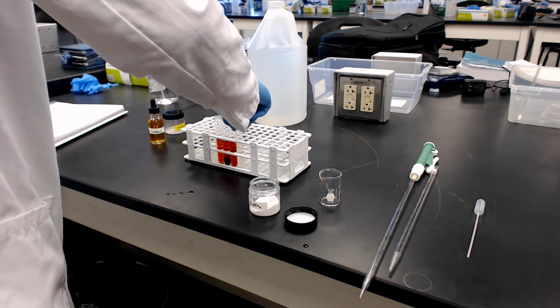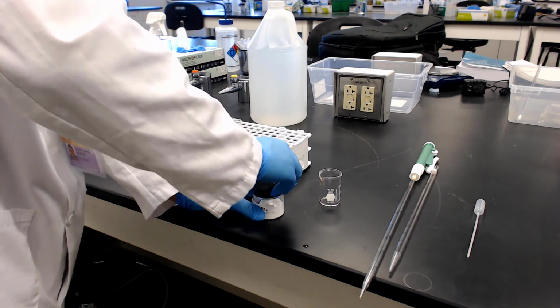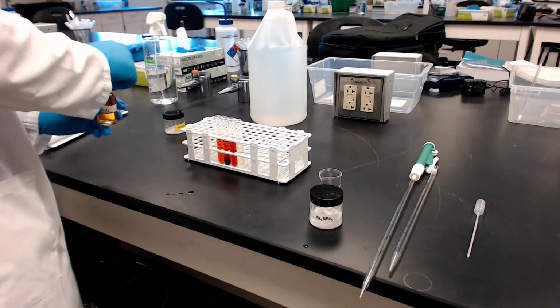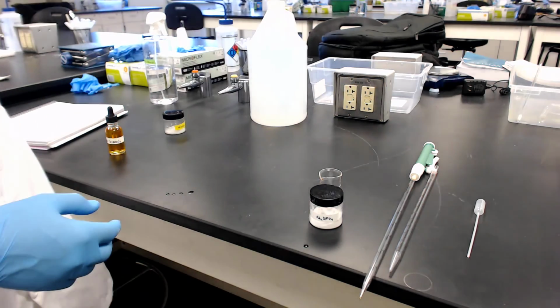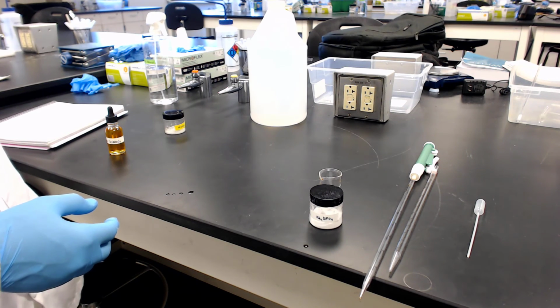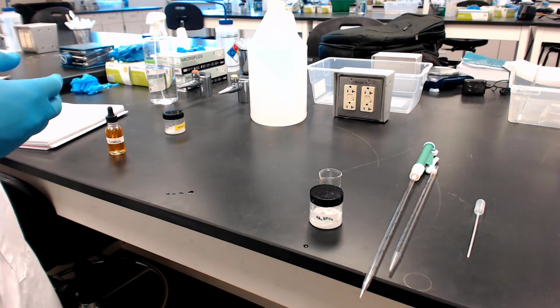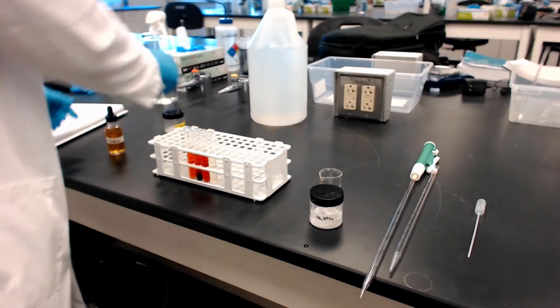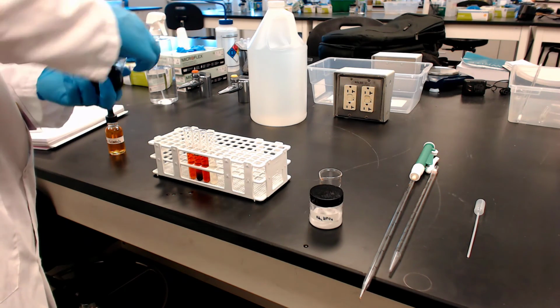So there you go. That completes step A, and we'll see if he gives us one good shot with everything done here. We'll see. There we go. And I think I'll also upload a picture that he may have made for all these tubes. So now you know how they're set up. On the far left is the standard.